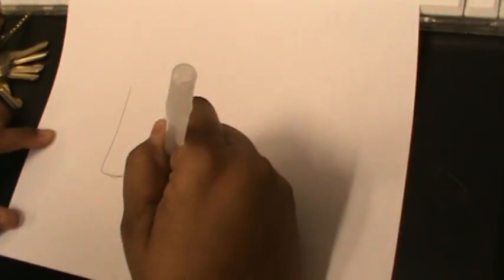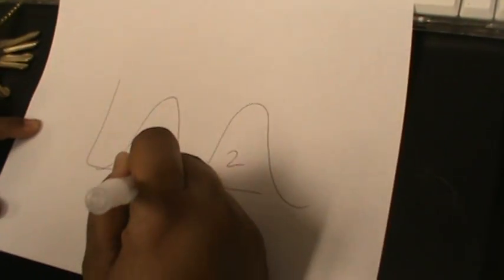So if you look, where are the colors? It's too small, but the green and the orange will be. I bet you have a pen. Okay. So this is channel 1, and this is channel 2. But we know that they actually move into this channel.